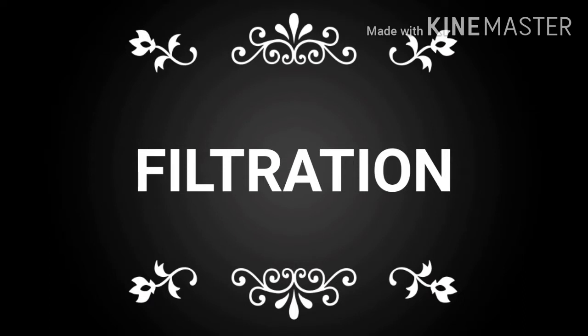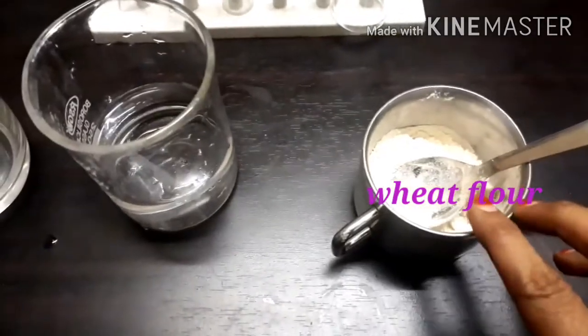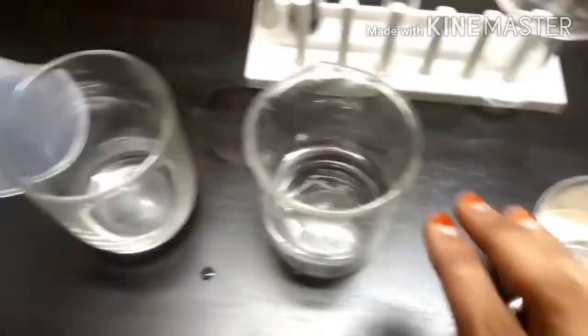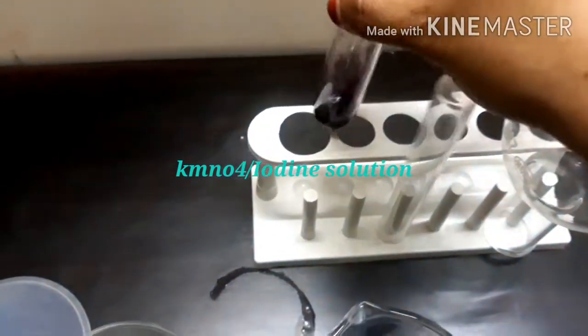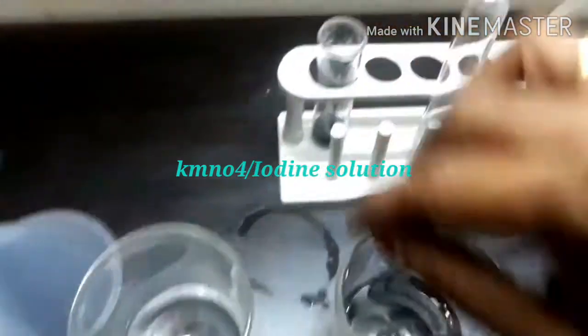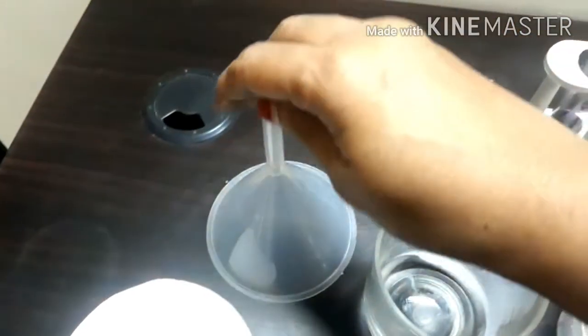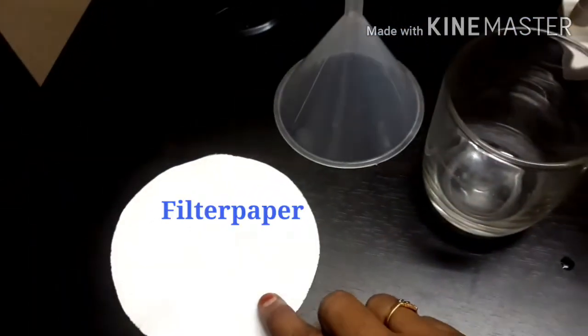This video explains the filtration process. To perform this activity we need wheat flour, beakers, potassium permanganate solution or iodine solution, a funnel, and filter paper.